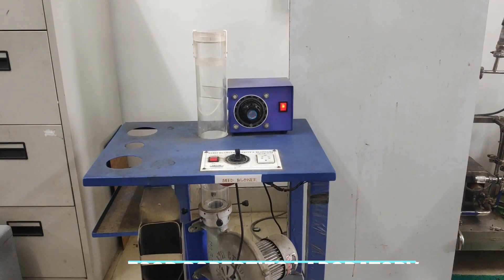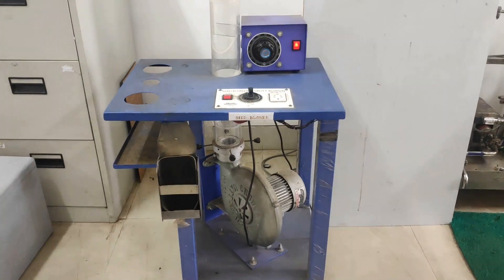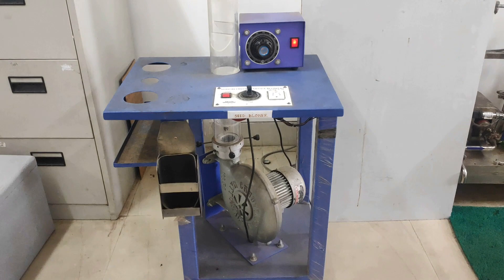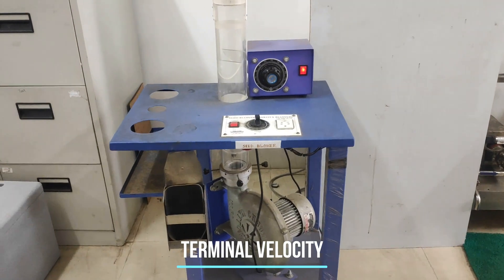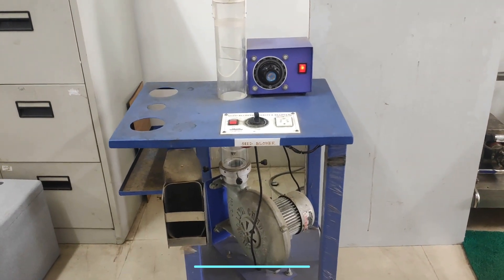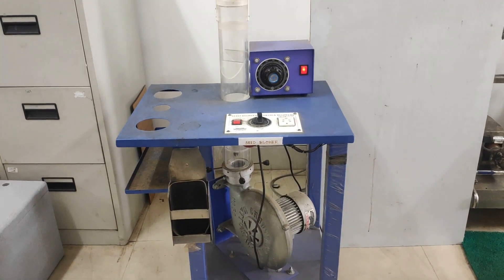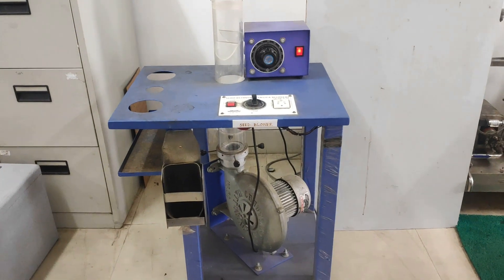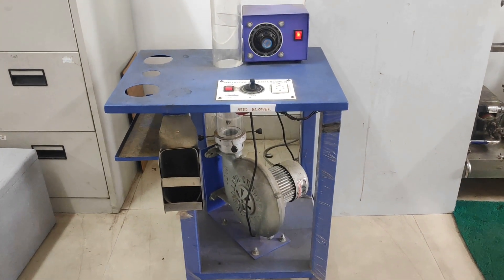Welcome to the Food Properties Laboratory. In today's experiment you are going to learn about terminal velocity. The aim of today's experiment is to determine the terminal velocity of a given seed sample.